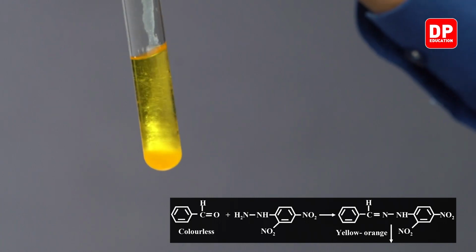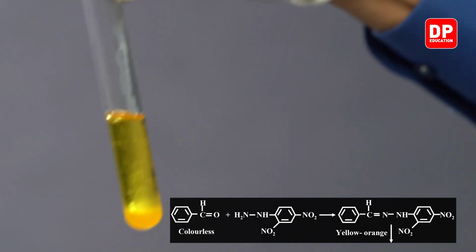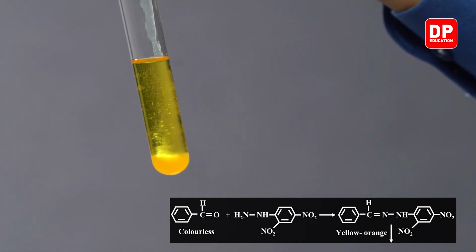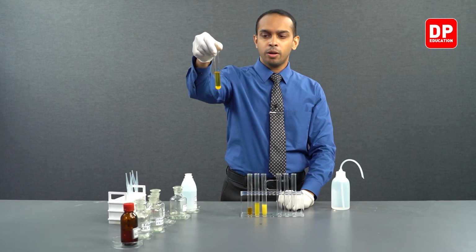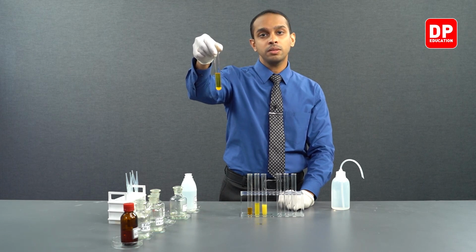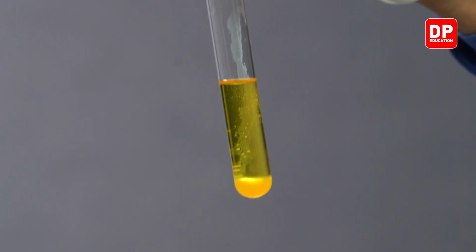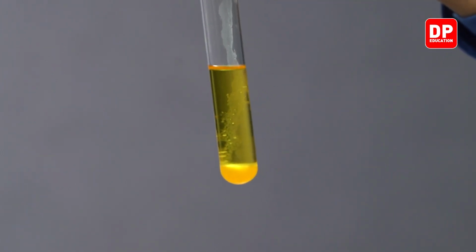So when I add a little bit of water, you can see the color change a bit more clearly. So you can see a precipitate that has formed. At the bottom, you can see the formed precipitate. A yellow-orange precipitate is formed. This is indicative of the fact that benzaldehyde is indeed a carbonyl compound that reacts with Brady's reagent.